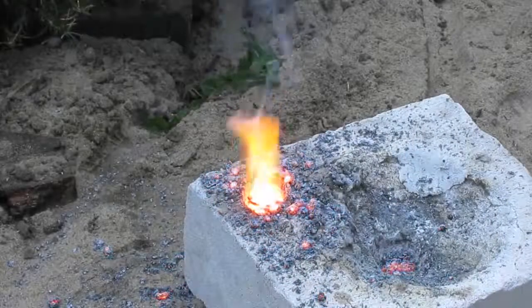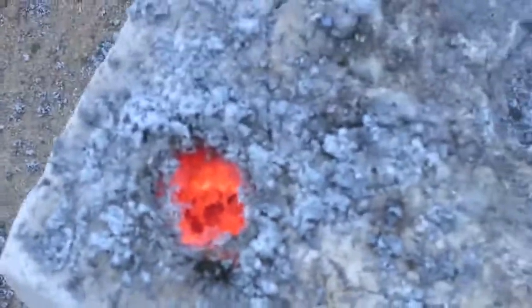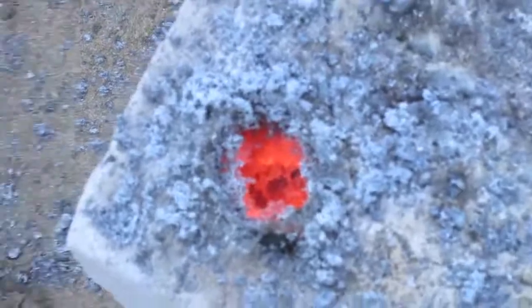Now let's check out whether some Si metal has formed. Have a quick look at the crucible, to the pit. It smells a little bit, so it's a very quick reaction. Now it's cooling down.